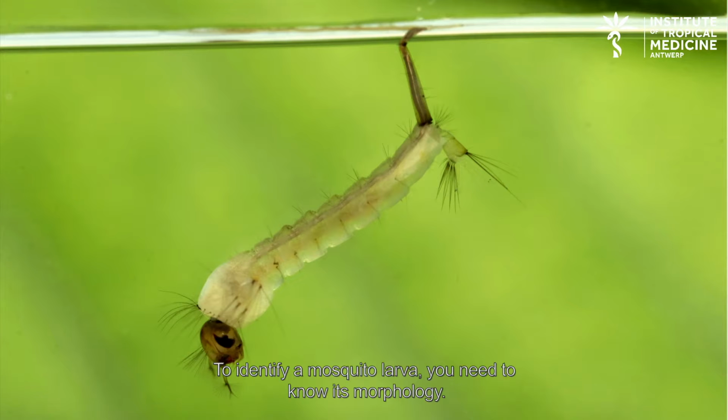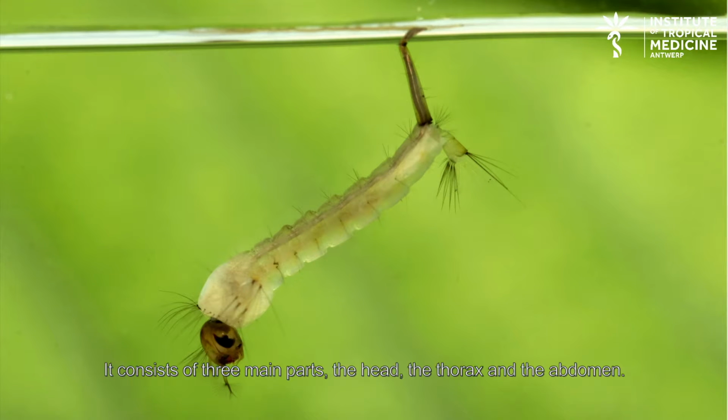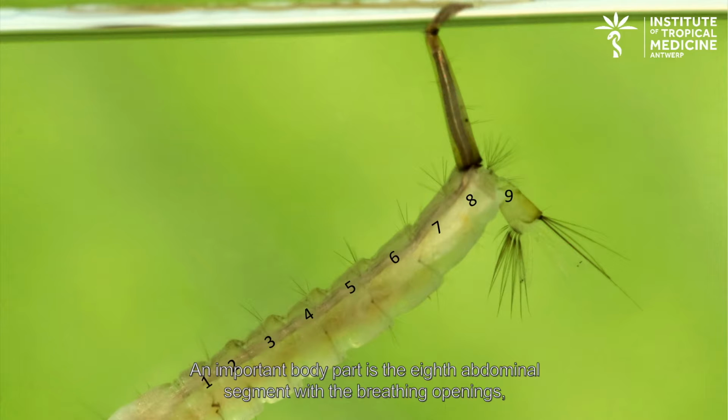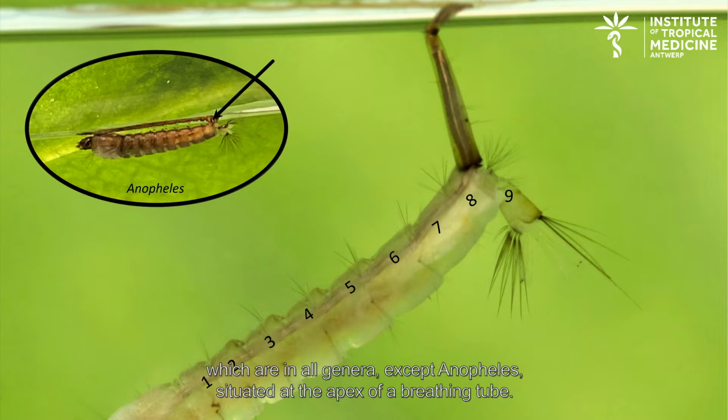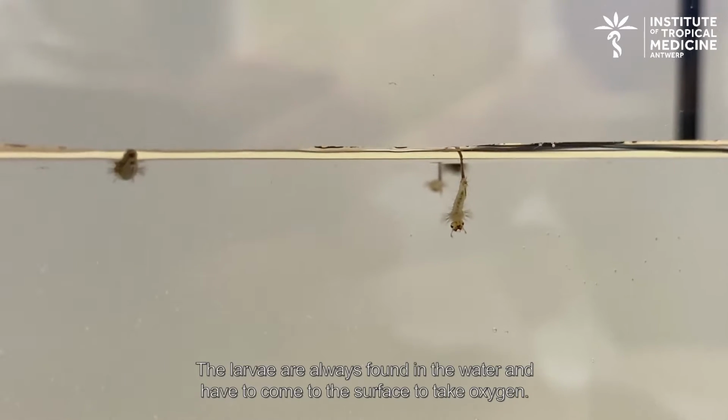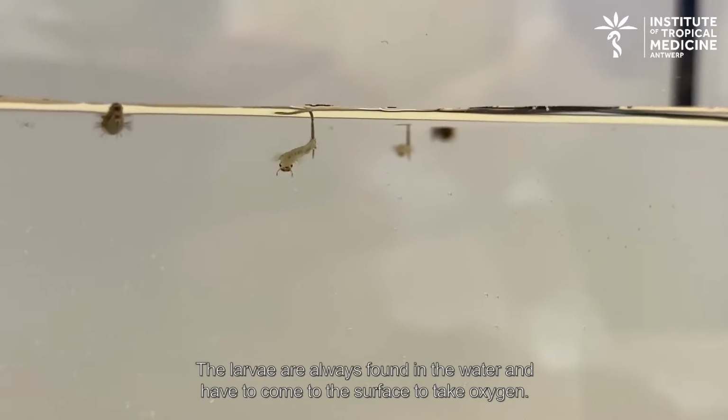To identify a mosquito larva, you need to know its morphology. It consists of 3 main parts: the head, the thorax, and the abdomen. An important body part is the 8th abdominal segment with the breathing openings, which are, in all genera except Anopheles, situated at the apex of the breathing tube. The larvae are always found in the water and have to come to the surface to take oxygen.